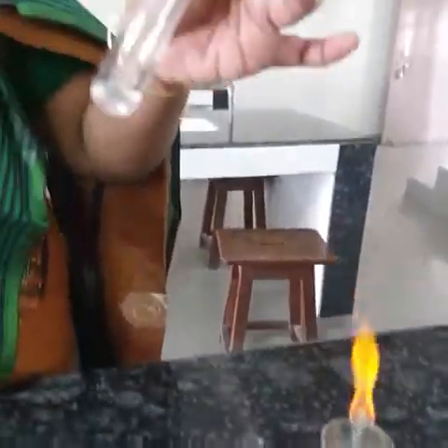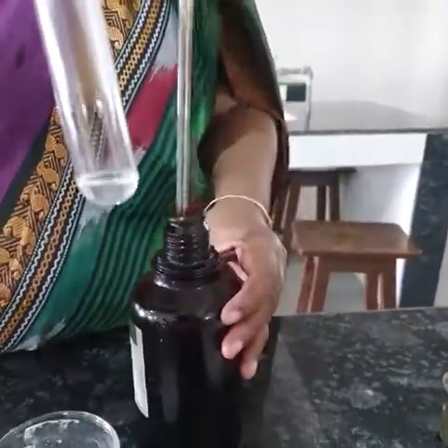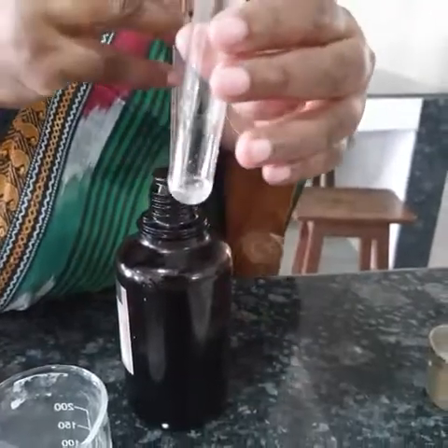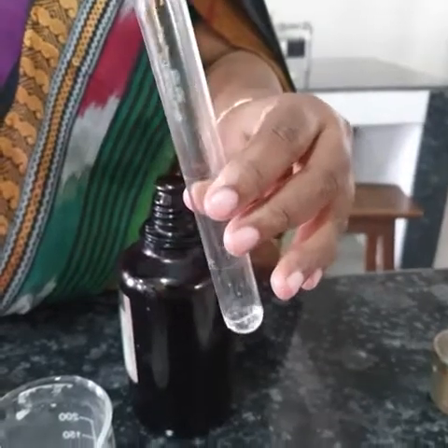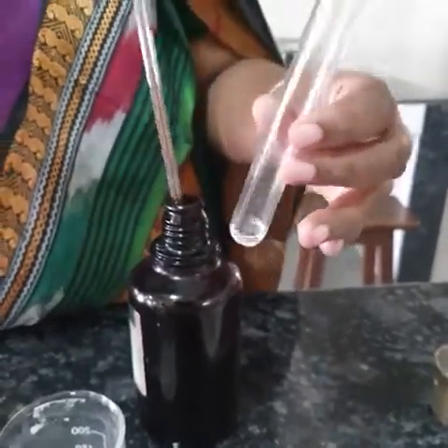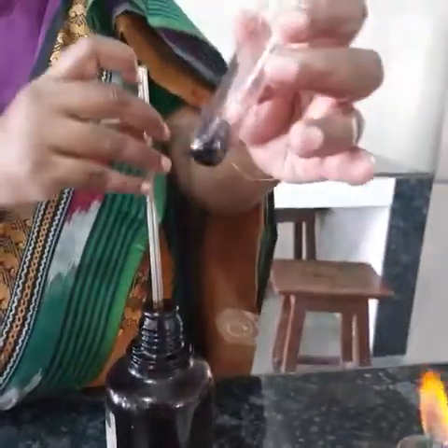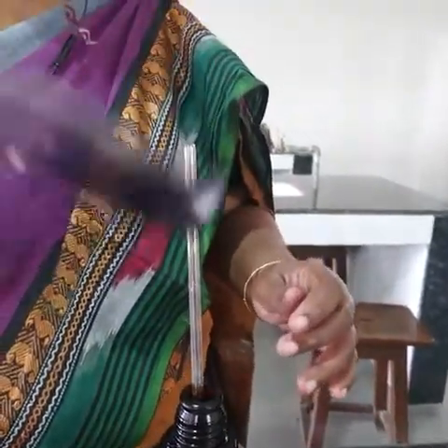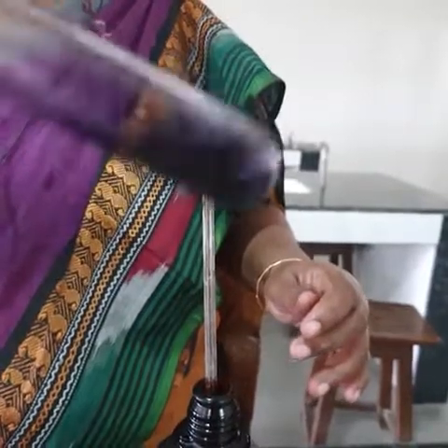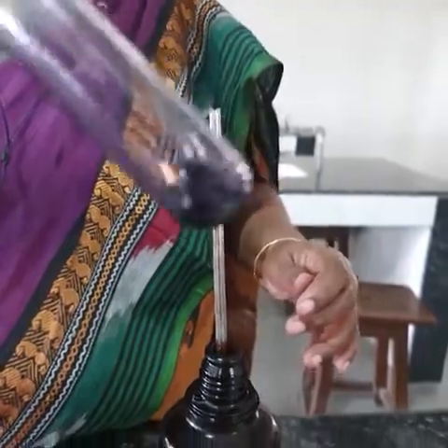The starch solution is transparent — it looks like water. To this, I am going to add only one drop of iodine, which is brown or yellow in color. See, it changes to blue-black color. Even a single drop can bring this change — it is completely blue-black. Thank you.